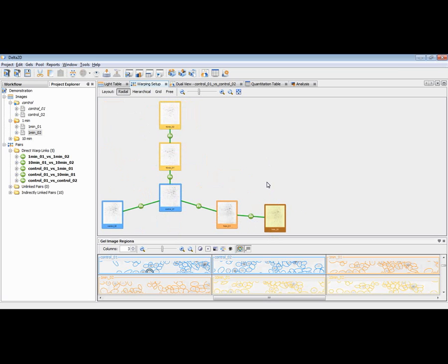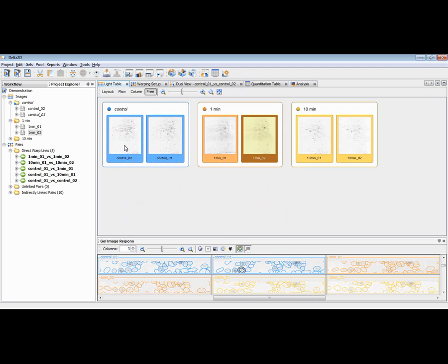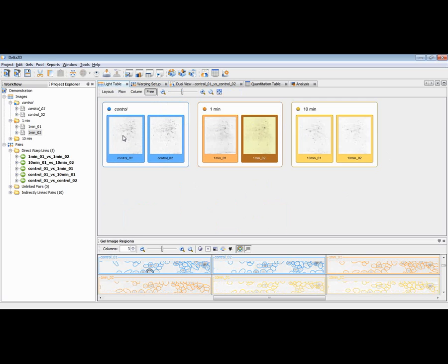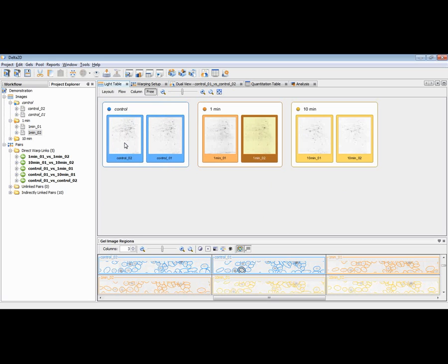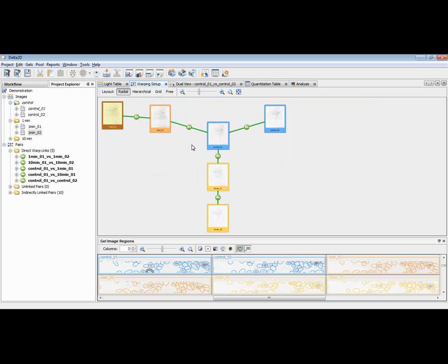Of course, we can also apply strategies instead of doing that manually. For large projects, that would be very time consuming and you might get lost. So the first step is, again, defining all the groups, and you should then define the best image of each group as the first one. You can easily change the order of these two images within each group. And if you think you should change that, because the best should be the first, you can easily do that, like this.